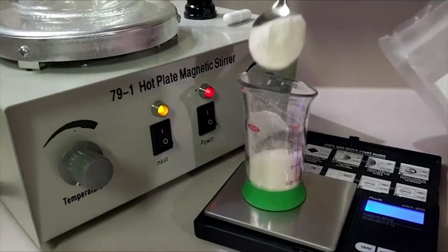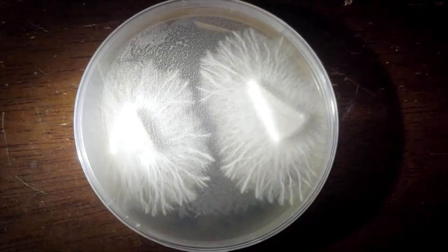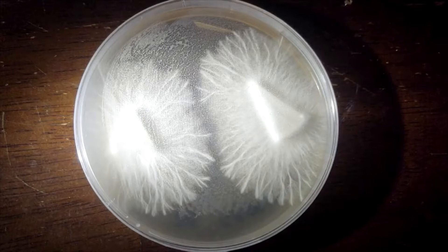We have discovered that less nutrients seem to be best when it comes to rhizomorphic growth. It seems that if you starve the mycelium, it really branches out to search for more nutrients, resulting in a branched look similar to a root system.